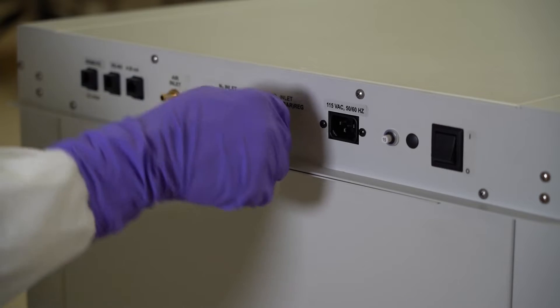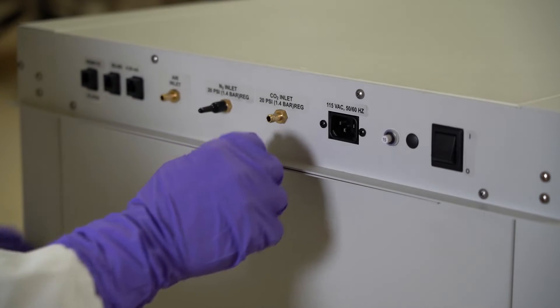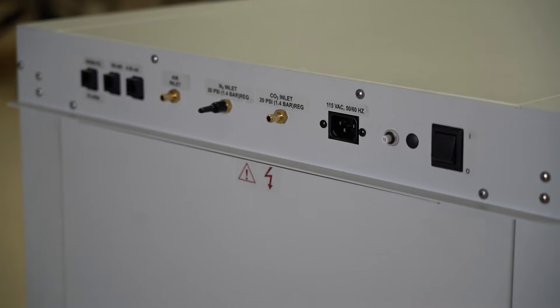Remove the black caps from the gas inlets. You will connect the gas inlets to gas supplied at a pressure of 20 psi or 1.4 bar.